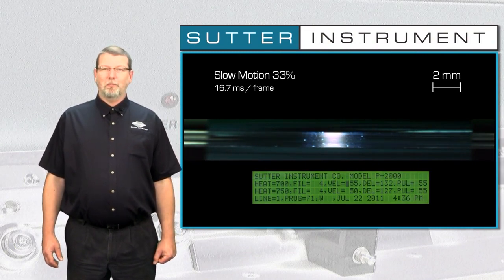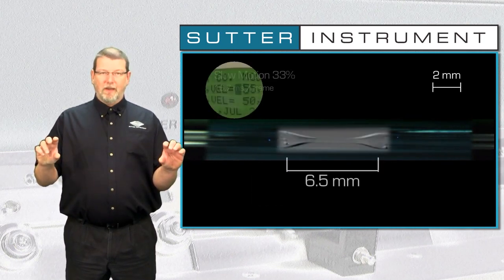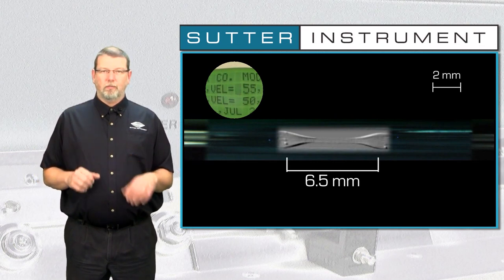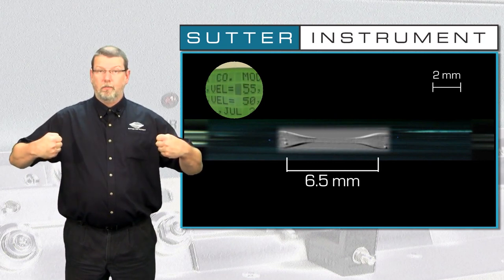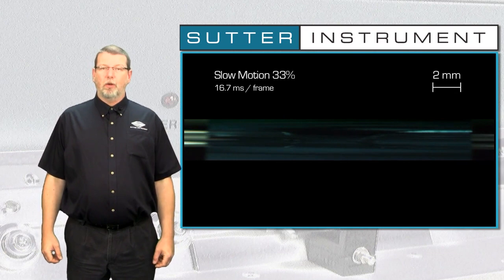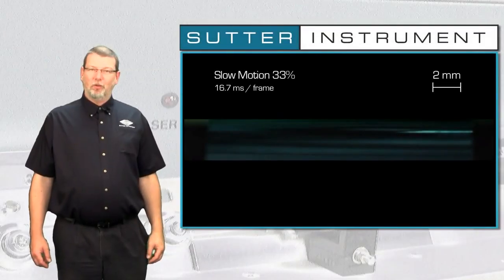All Sutter horizontal pullers monitor the movement of the puller bars. The velocity of the puller bars gives us a very good idea of the viscosity of the glass, which in turn reflects its temperature. So the velocity parameter in essence defines the glass temperature at which the heat is turned off and the hard pull is executed. So a higher velocity value gives the glass more time to draw out, which then leads to a longer taper of the final pipette. In the meantime, the pipette has finished pulling.